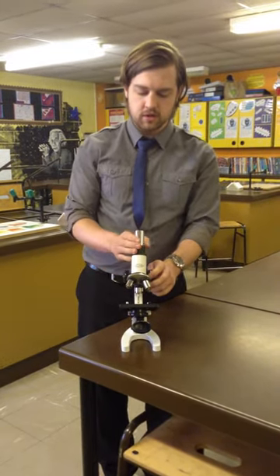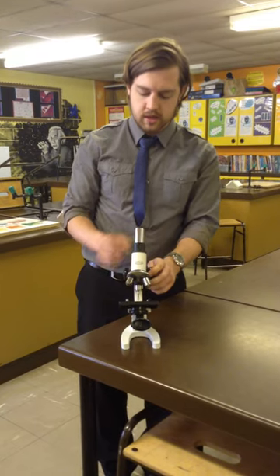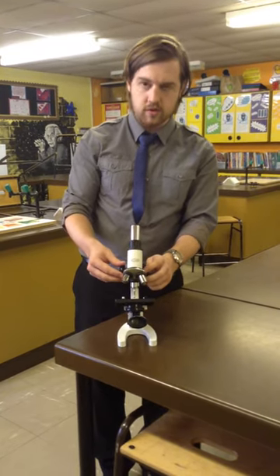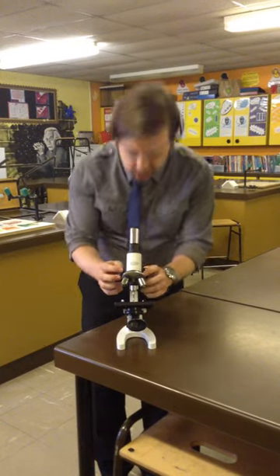Next thing you're going to do is look down the eyepiece lens and move the focusing knobs to try and get a perfect picture.